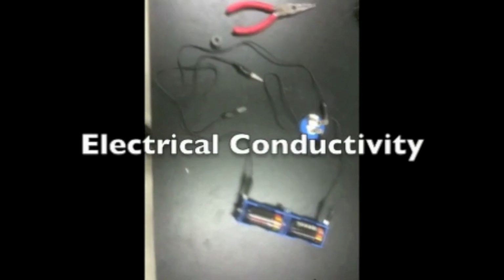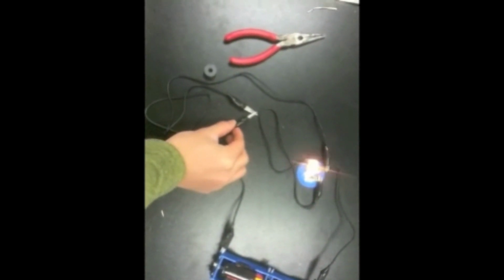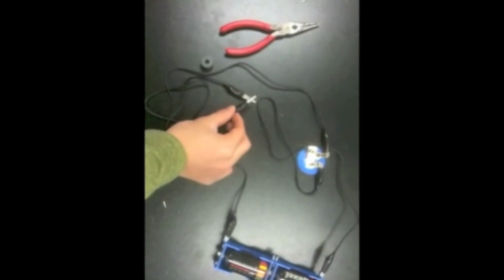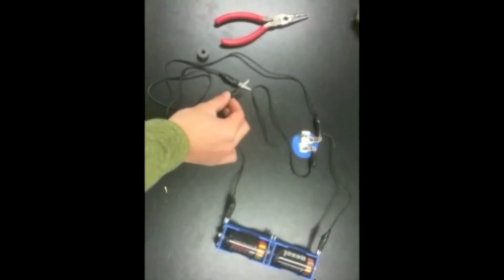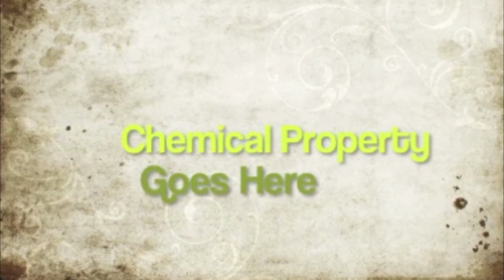Now, the last physical property is electrical conductivity. Similar to thermal conductivity, electrical conductivity tests if a substance can actually get the electricity very well and very fluently. As you can see, as these two cords meet together, the light bulb seems to flash out, which means that it has great electrical conductivity. Now, let's talk about chemical properties.